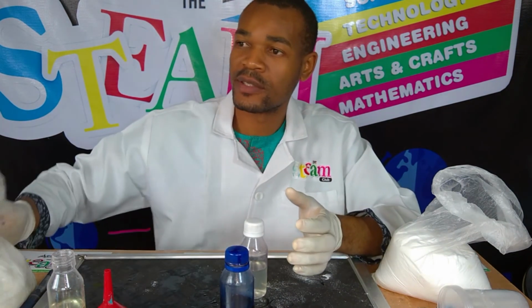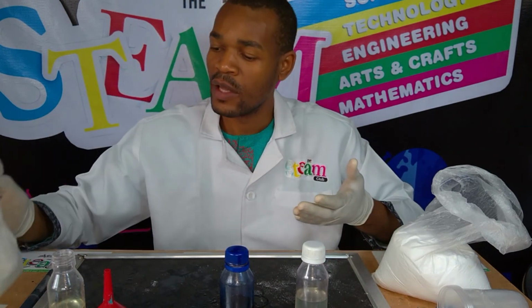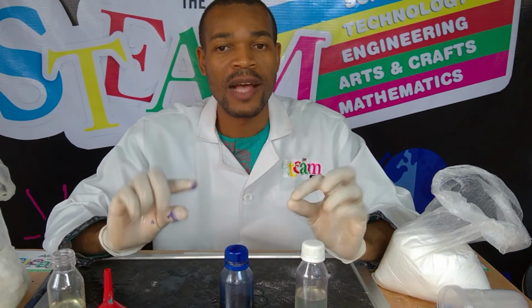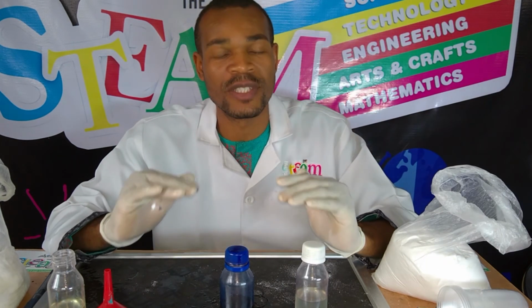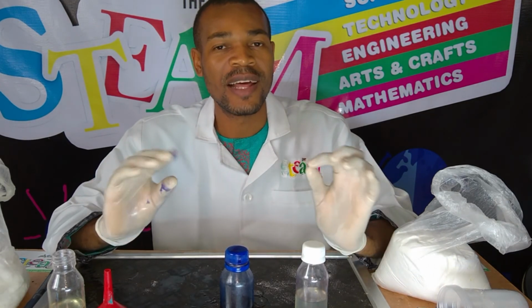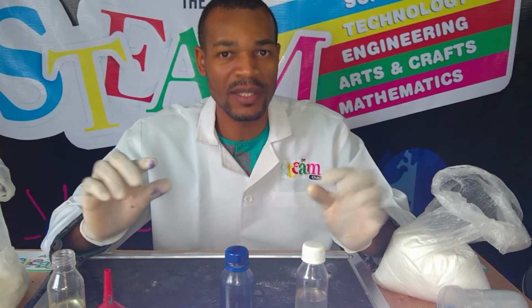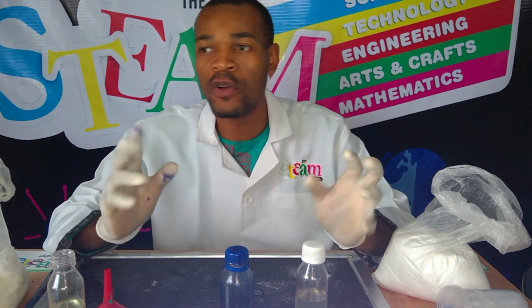So how about this? What does it do? That's the potassium hydroxide. Now, there is a reason why people study acids and bases. Acids and bases are compounds that you use to balance off things. They don't really take part in a reaction, so to speak. They are there to help a reaction to take place. They are not catalysts per se, but they are there to provide the environment for that reaction to really take place. I'll give you an instance.